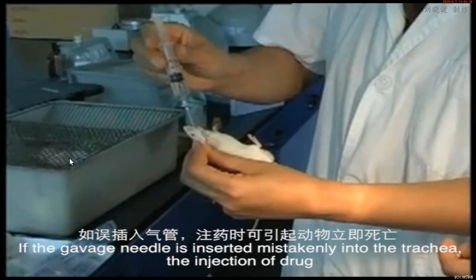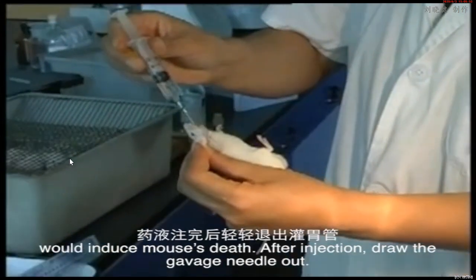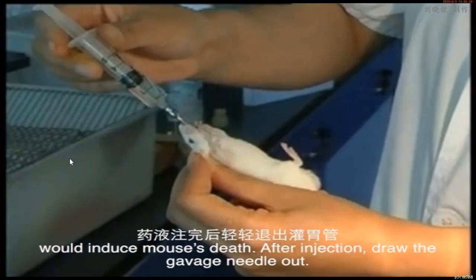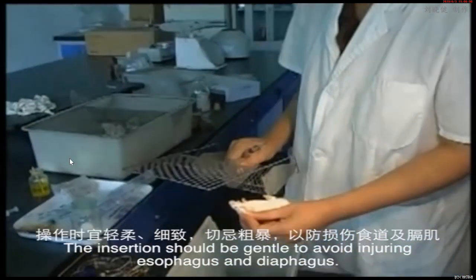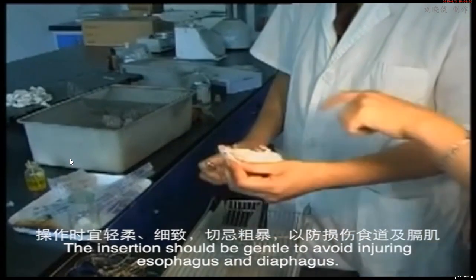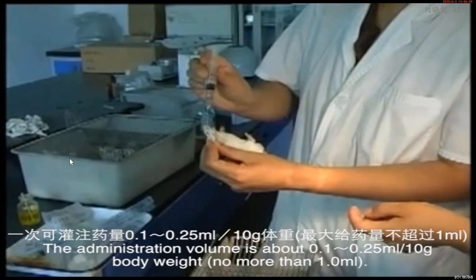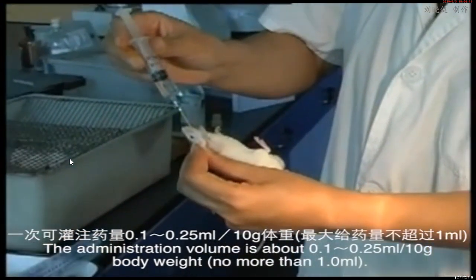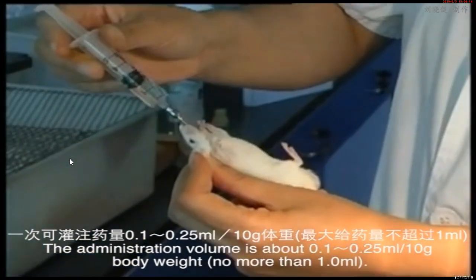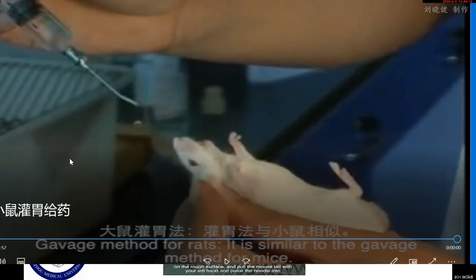If the needle is inserted mistakenly into the trachea, the injection of drug would induce the mouse's death. After injection, draw the gavage needle out. The insertion should be gentle to avoid injuring the esophagus and diaphragm. The administration volume is about 0.1 to 0.25 milliliter per 10 gram body weight, no more than 1 milliliter. Gavage method.